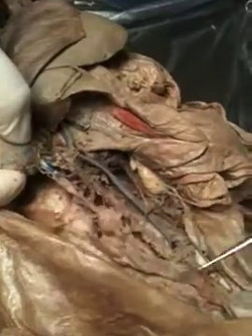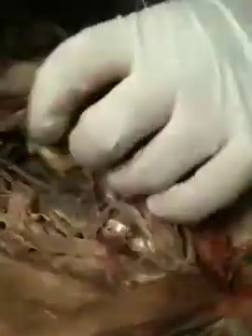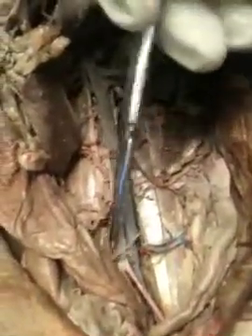And then from there, you go down and run into the, this one right here, which is the iliolumbar vein. In that matter, that would be the left iliolumbar vein.